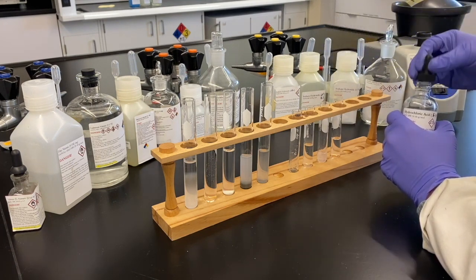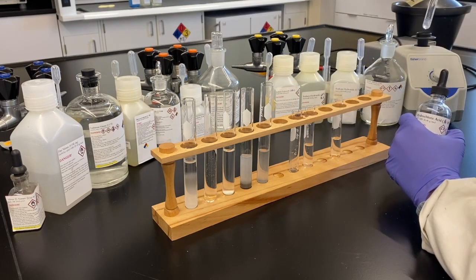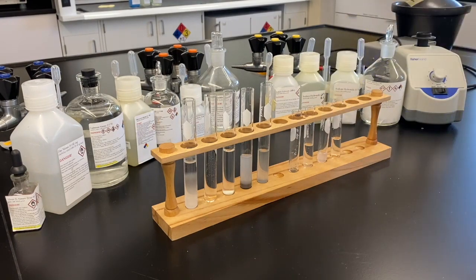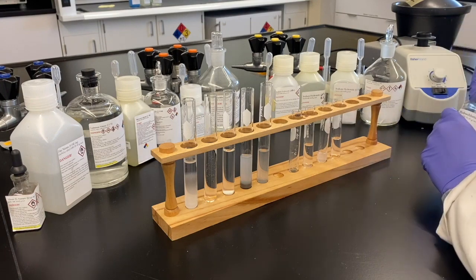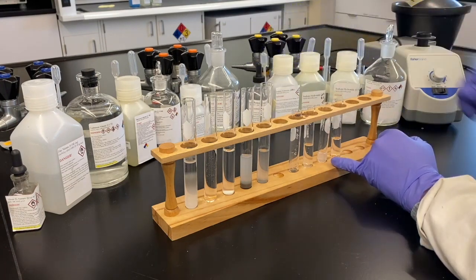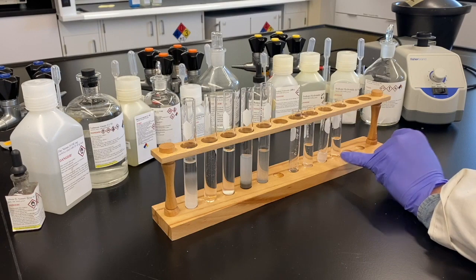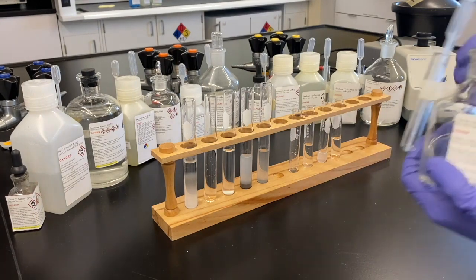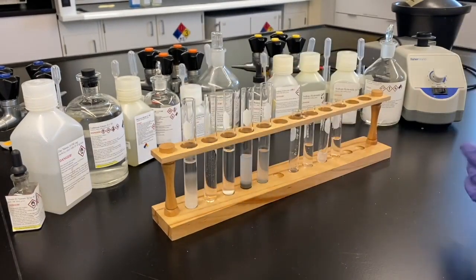So notice that precipitate we did have, the orange one, it did dissolve. We have a bit of a white precipitate here showing up. This probably is just carryover from the mercury 1 that we found earlier. Our separation process here isn't perfect, so we can get a little bit of cross-contamination from supernate to test tube. So we're not going to take that too seriously, as we've already tested in under acidic conditions.